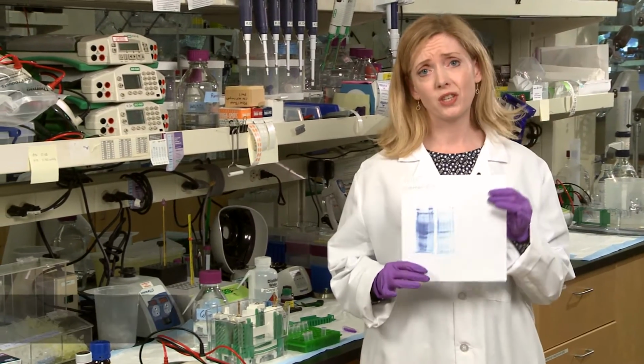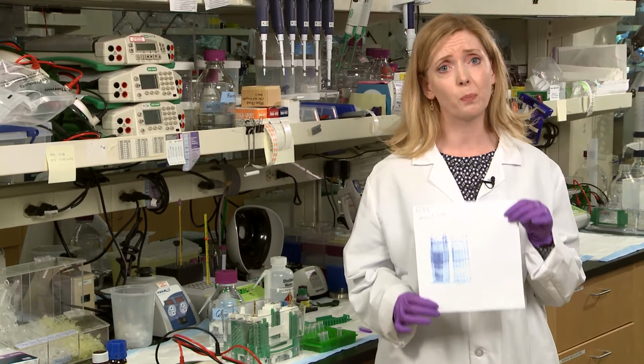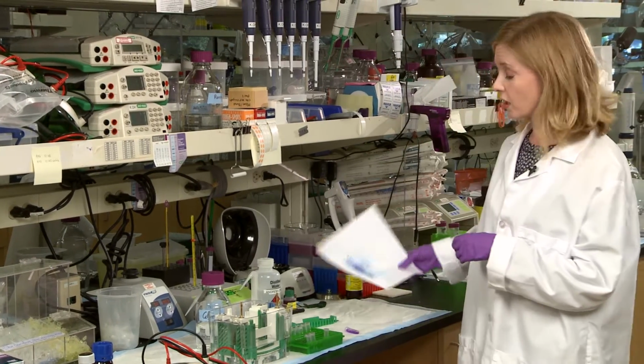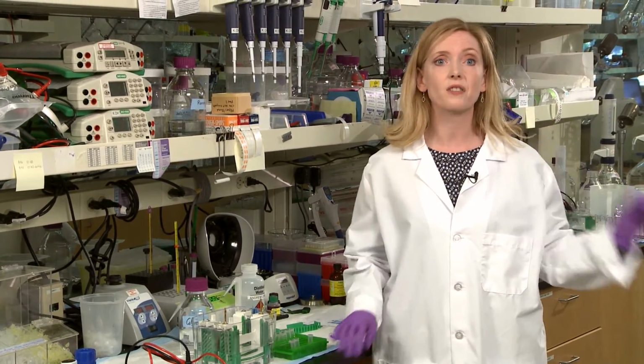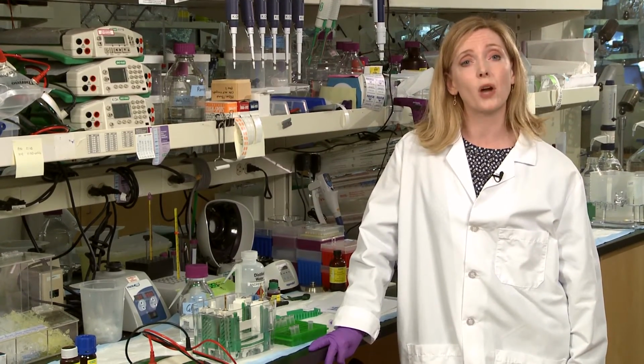Ever end up with a beauty like this? A gel so ugly you were embarrassed to show it to your lab mates or your PI. Or maybe you've watched your sample float ever so slowly out of the top of the gel well. Well, here's four tips that address common sample loading woes.